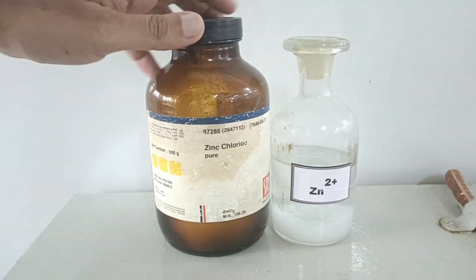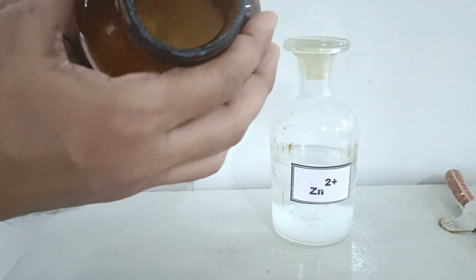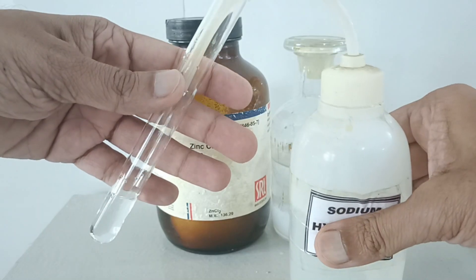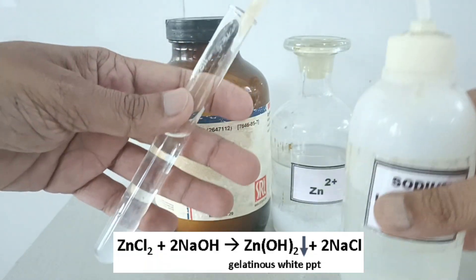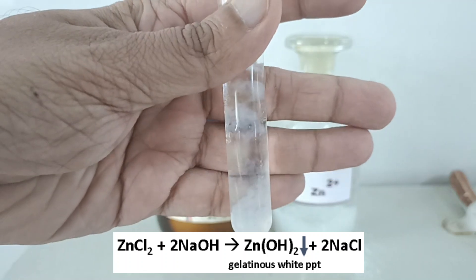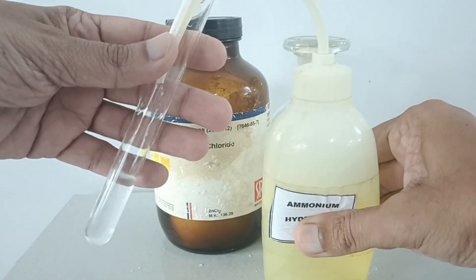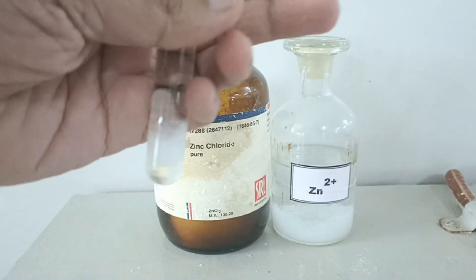Here I have white colored zinc chloride salt and its solution. I am adding about 1 ml of sodium hydroxide to the zinc chloride solution. White gelatinous-type precipitates are formed immediately. With ammonium hydroxide, similar white gel-type precipitates are formed.